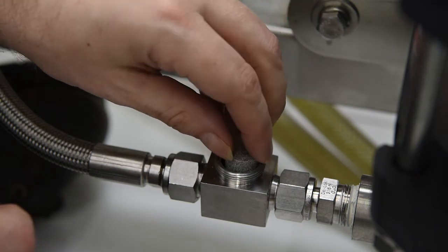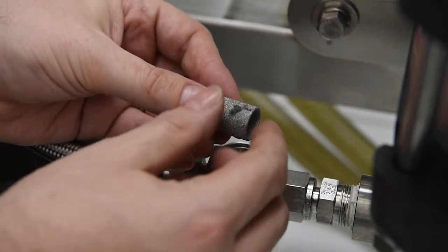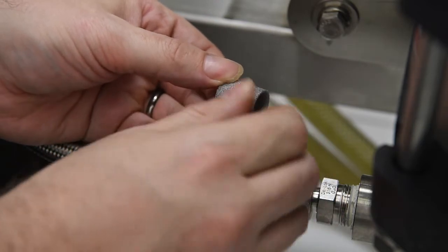Next, carefully remove the filter. Clean the filter with ethanol or acetone and let dry completely.